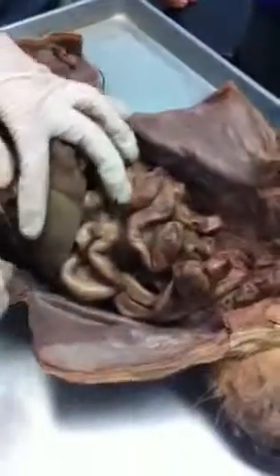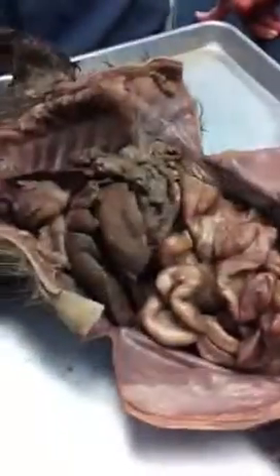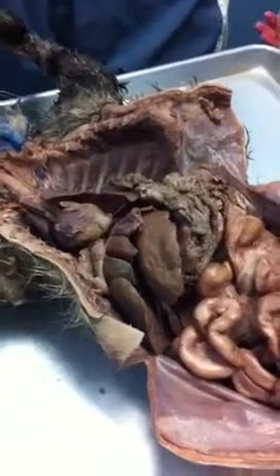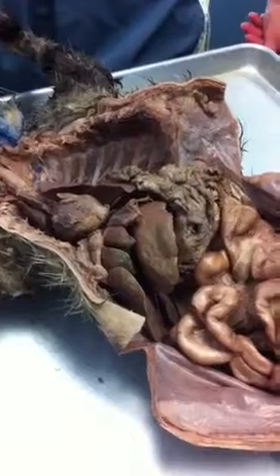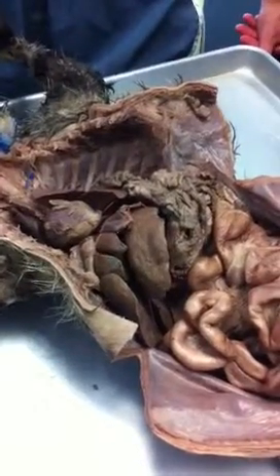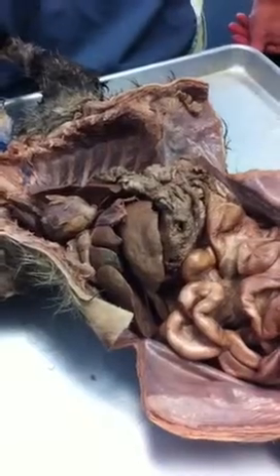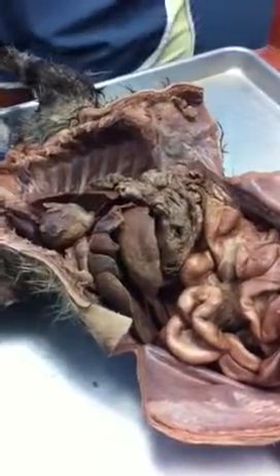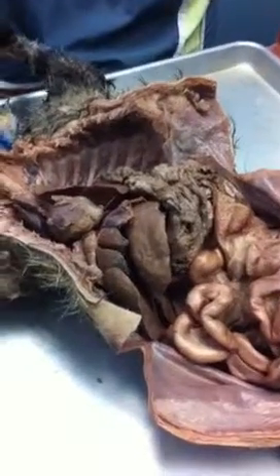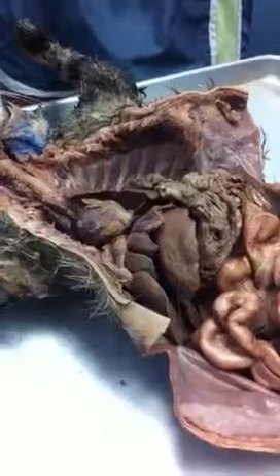What is this right here? Gallbladder. That's the gallbladder. Stores bile secreted into where? Small intestine. Duodenum of the small intestines. What's its function? No, not reduces the pH. It's not something with enzymes. It physically emulsifies fat into smaller molecules so that the lipases can work on them. Okay, it's a physical emulsification of fat.